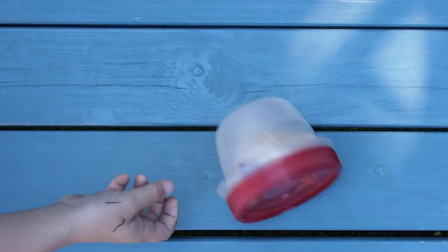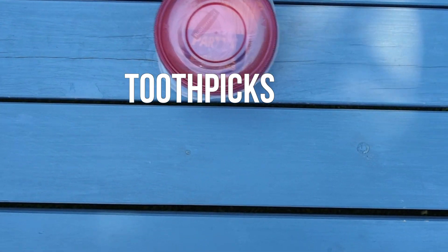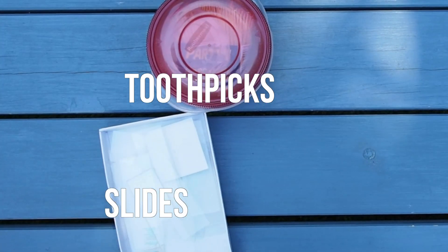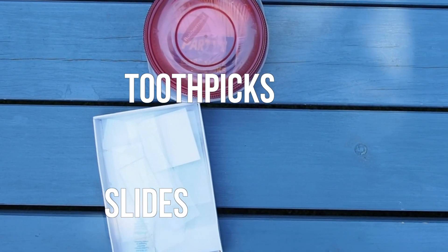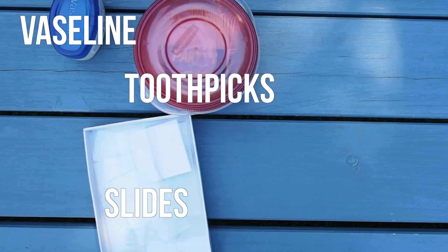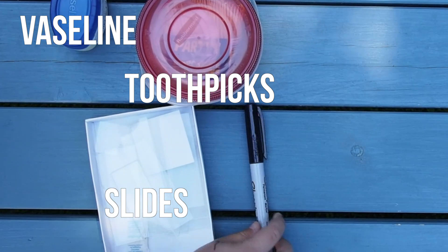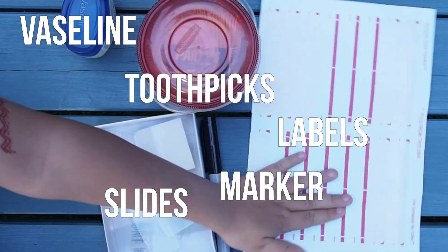For this experiment you will need toothpicks, microscope slides, Vaseline, a marker, and labels.